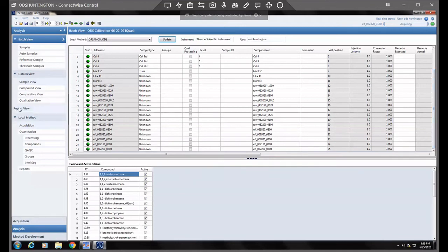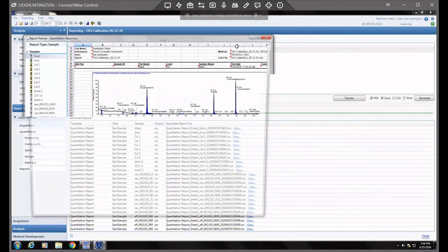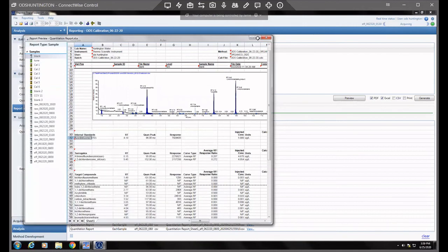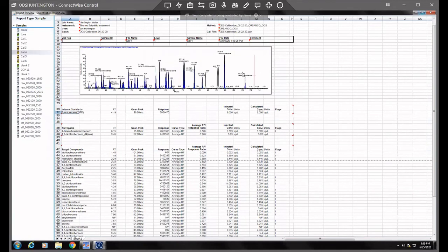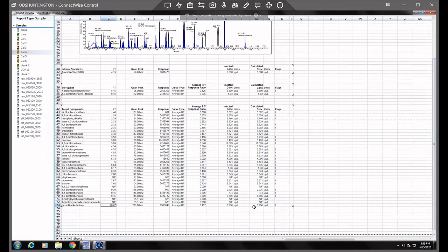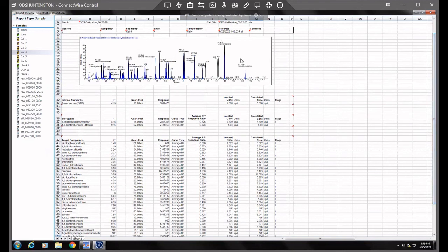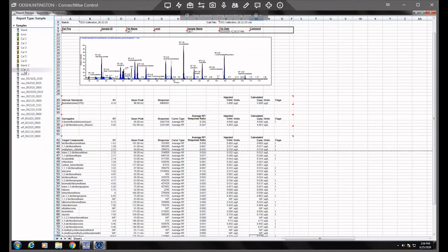Okay, so we'll go ahead and pull up our report and our quantitation report. The file that we were basing it off of was the Cal4 file. Let me open this up. So now it's turned blue, and we'll look here at 10.67 and 5.2 on the concentration. So now we know it's integrated into the method, so it knows our new expected retention time is 10.67. That should go for all of the samples. As you can see, they all say 10.67. So it looks like we were successful.